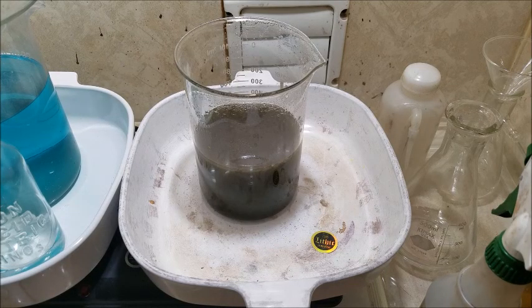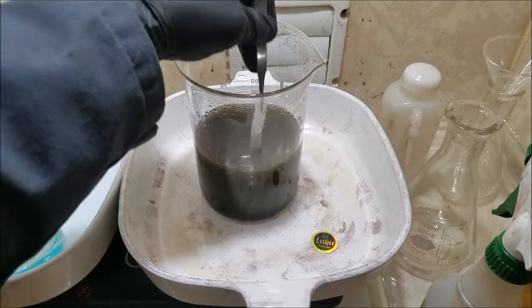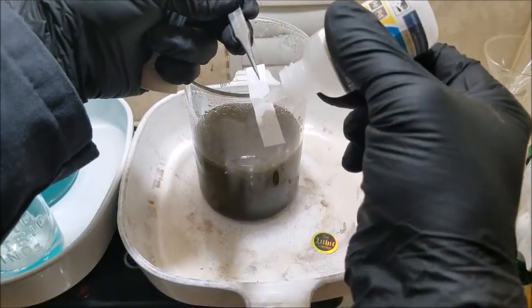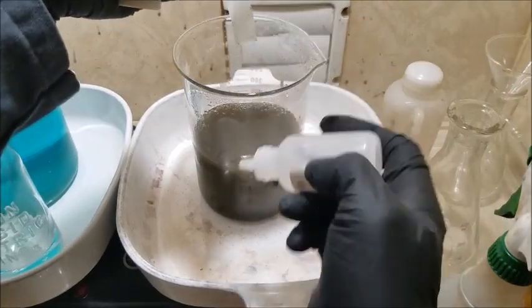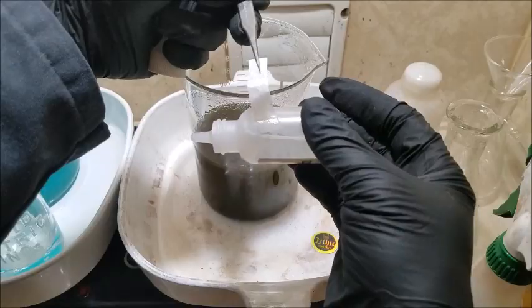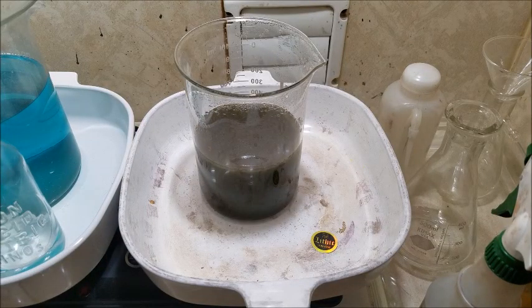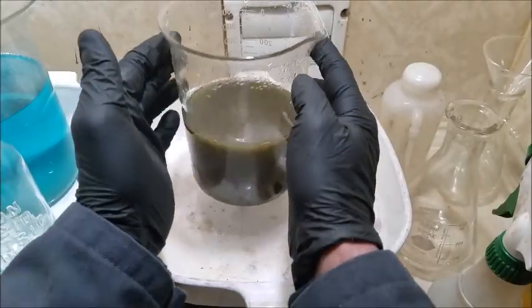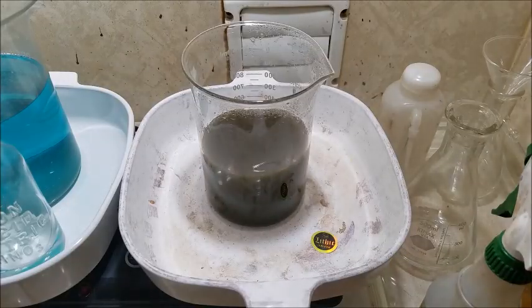Now we're gonna have to look close, because when we did this before, it was hard to even see a sign of gold. Let's take another look here now. Any signs of gold there? So I'm going to take that as a negative result. Assume that the gold is dropped out of solution. Looks like a lot of stuff is dropped out of solution. I'm a little worried I just dropped all that iron right back out. Oh man. Well, I'm going to get a filter set up and I want to start running this off.